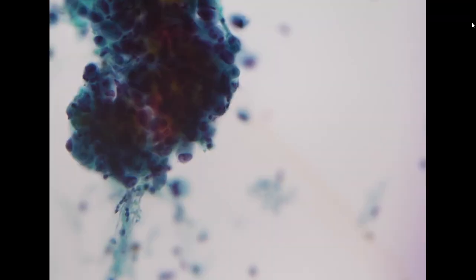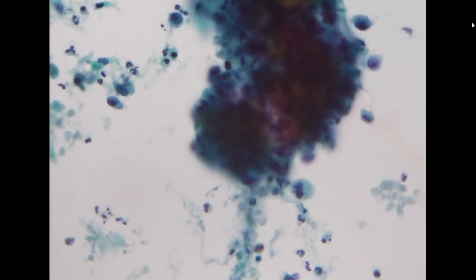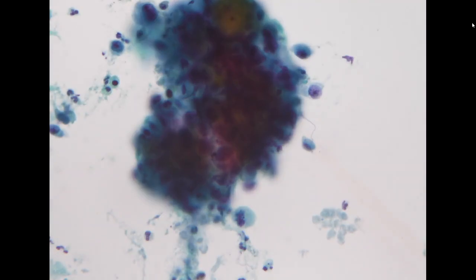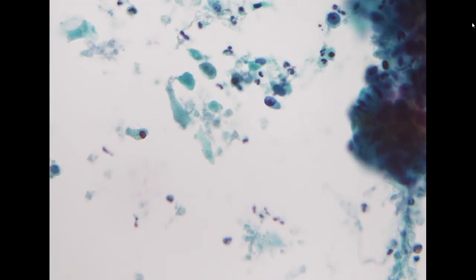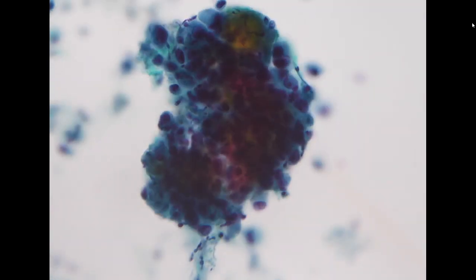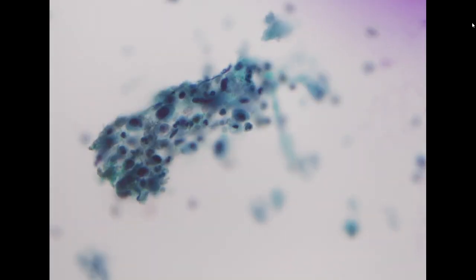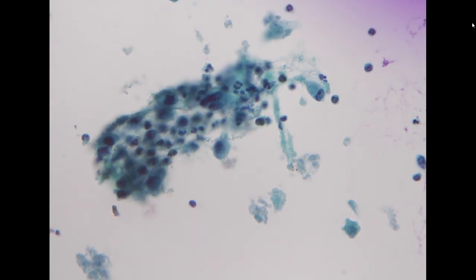If we can find some well-preserved area, for example like here, this suggests it is a malignant specimen, and looks epithelioid with marked necrotic debris and inflammation. So the primary diagnosis you need to think about is whether it is anaplastic thyroid carcinoma, or a metastatic high-grade malignancy from another primary, or direct invasion into the thyroid.